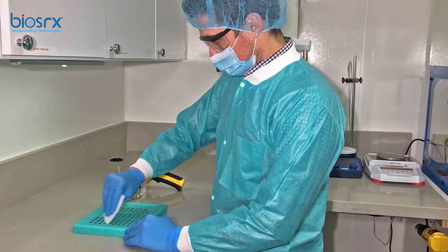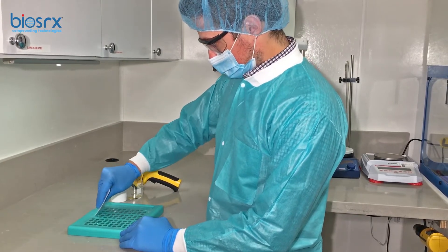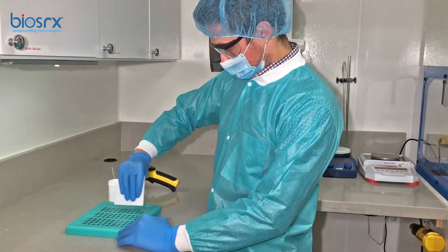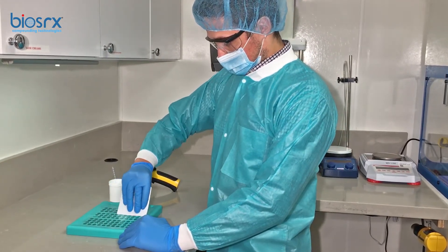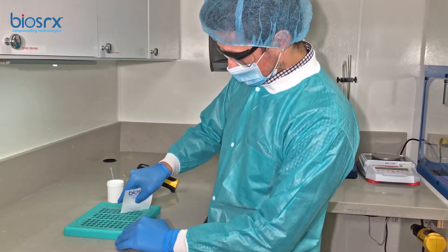The main goal for the technician right now is to just visually make sure every cavity is filled. So once we know that, then we'll swipe everything. Make sure there's no air pockets — this would be a good time to try to identify those.